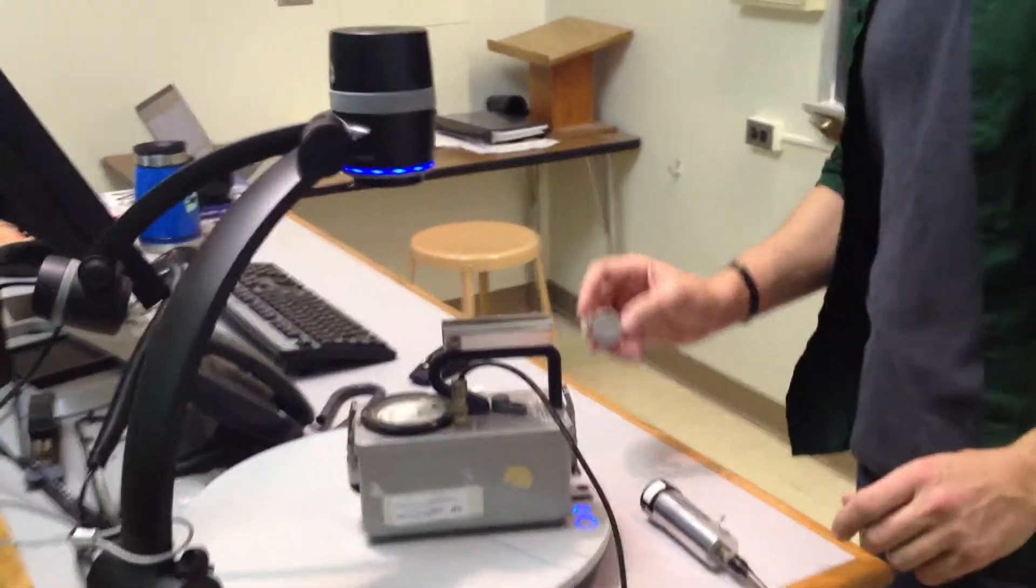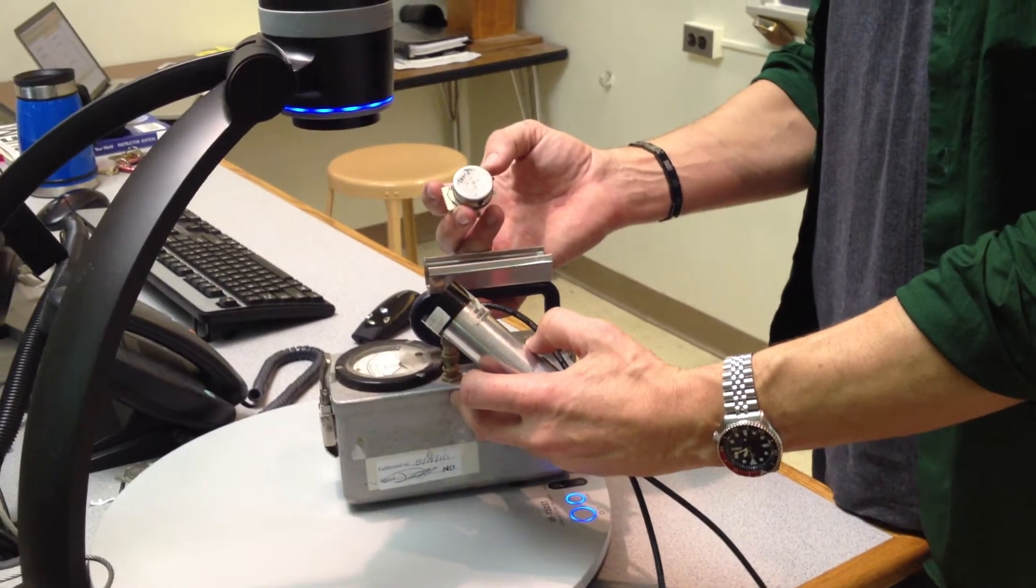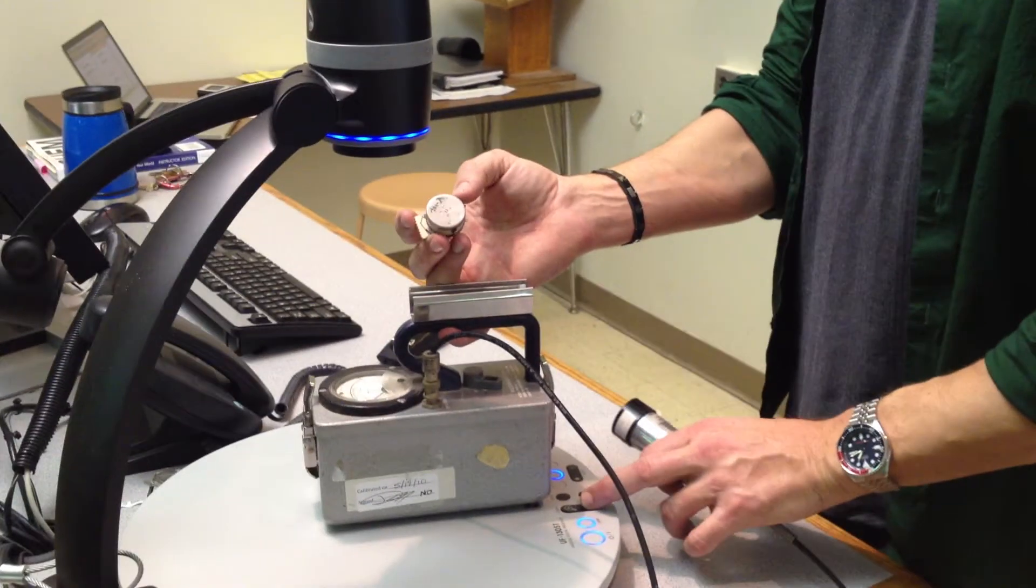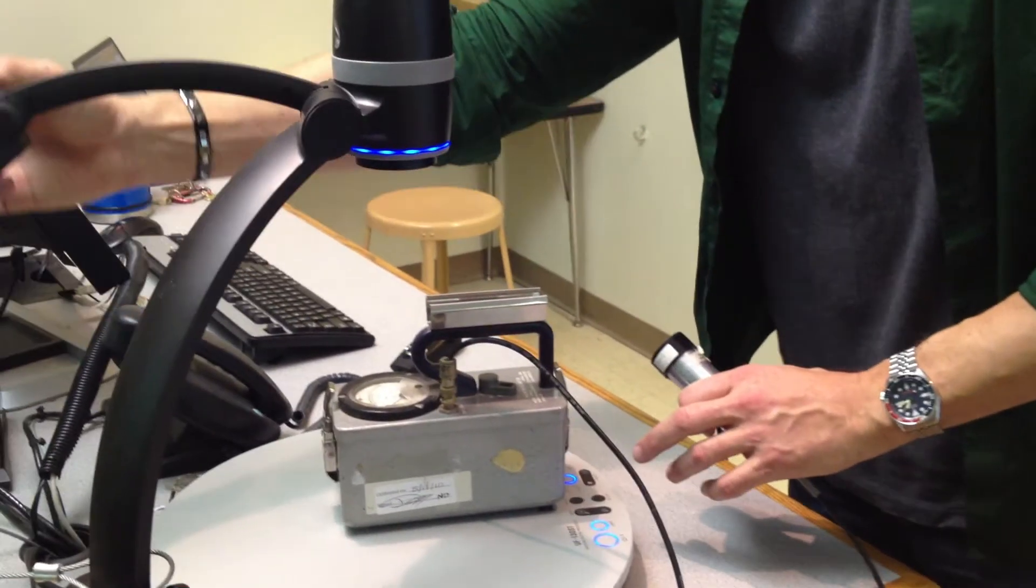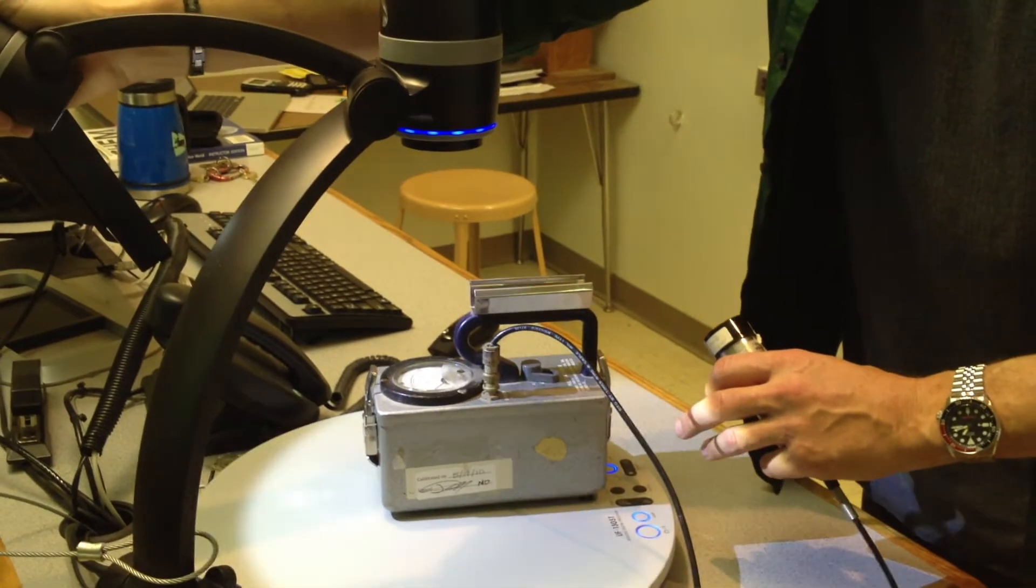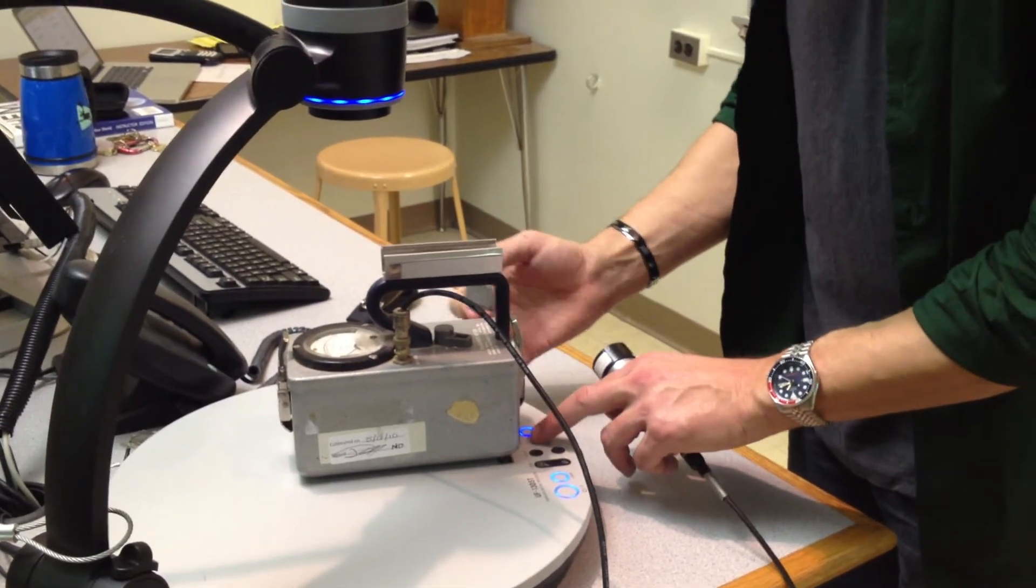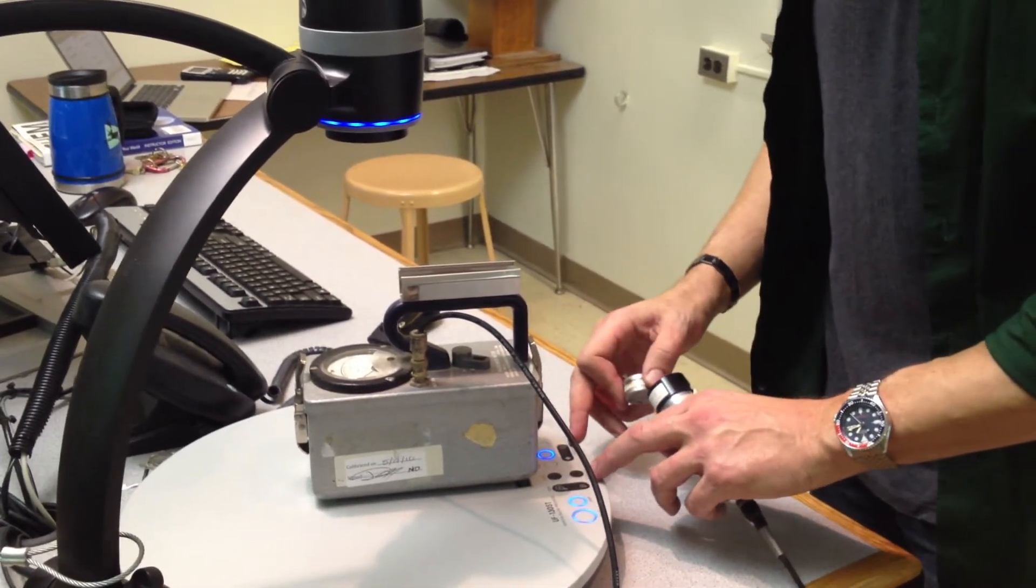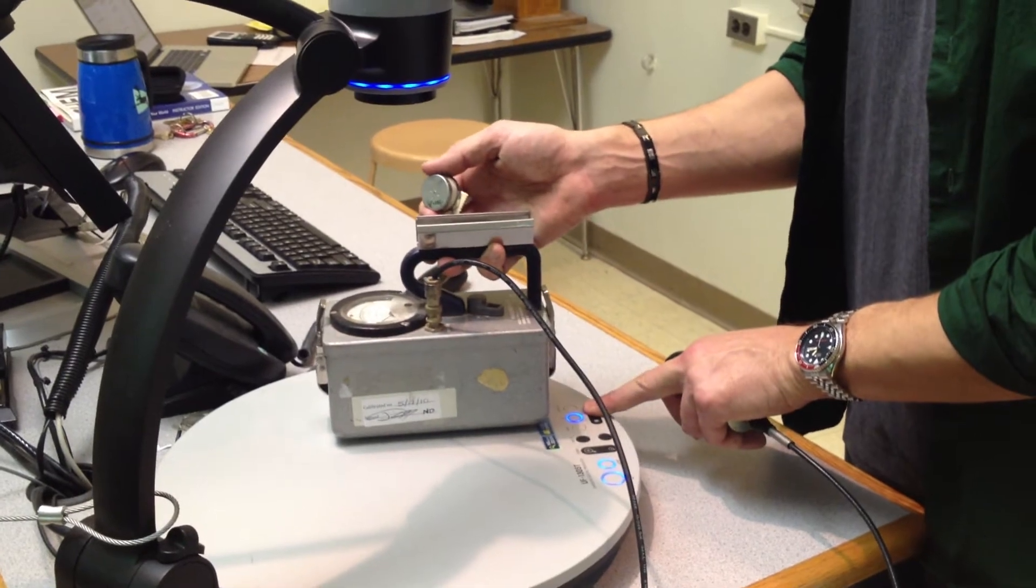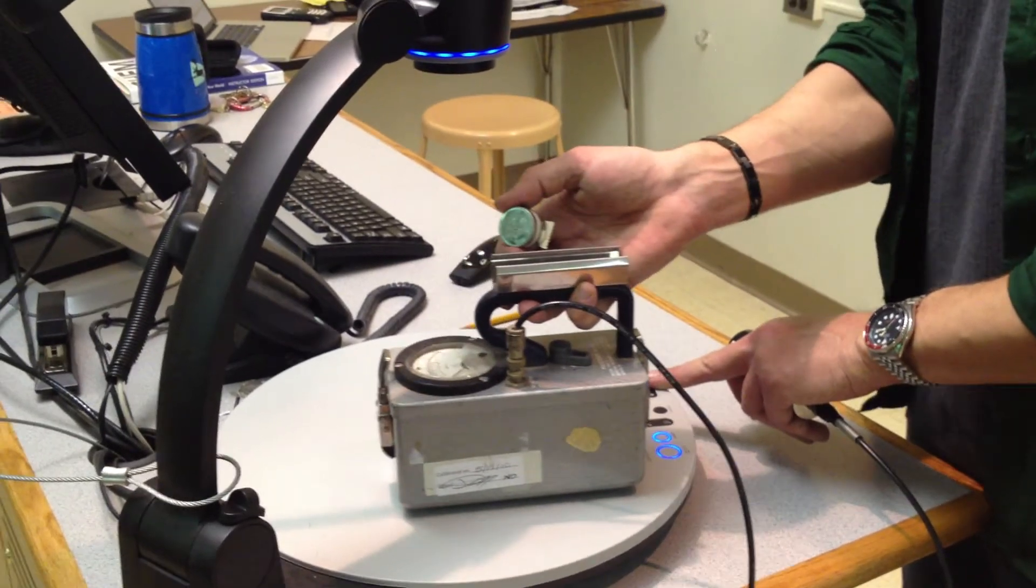Now, I'm going to boost the scale up a little bit. I'm going to do this like - whoa, what happened? Hit the rotate button. Let's do it again. Zoom out. And, maybe hit the lamp if that helps. Give me a second. I want you to not have the glare.